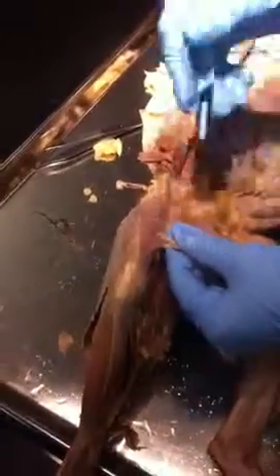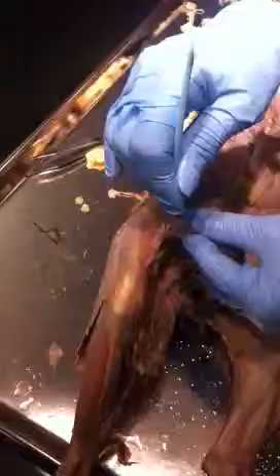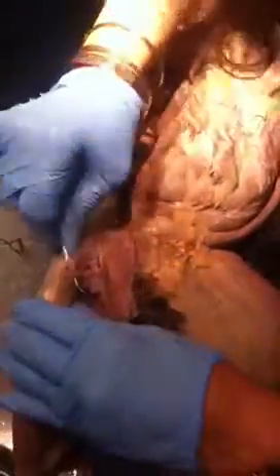So when you reflect them — and actually this is part of the muscle too, so we have to remove it.